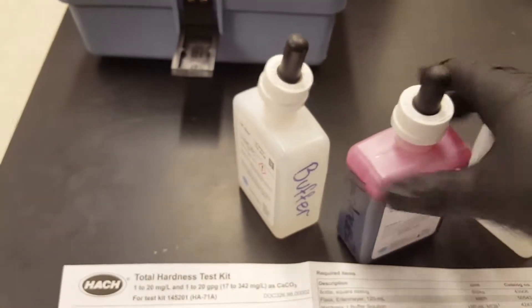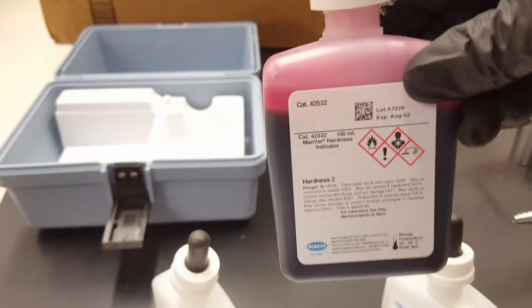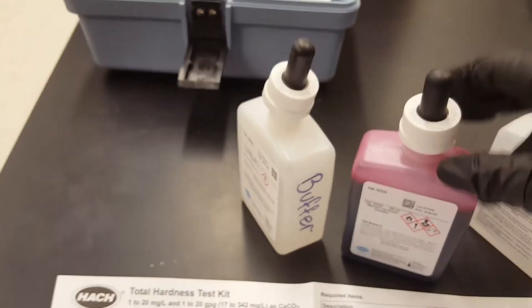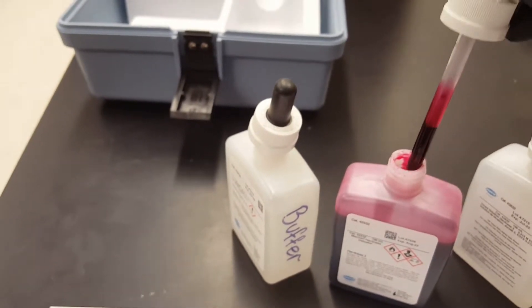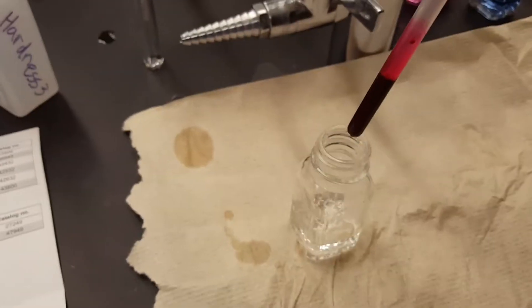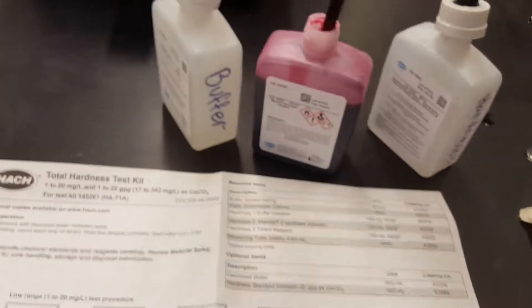Please note that many of these chemicals are flammable, caustic, so proceed with caution. Use all necessary protective gear when you're handling these chemicals and remind students to close them in between experiments. We do not need to keep these open.